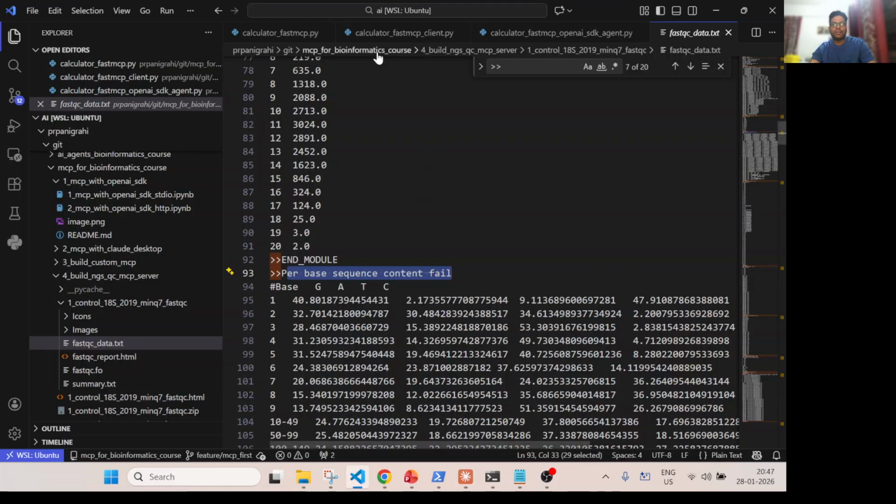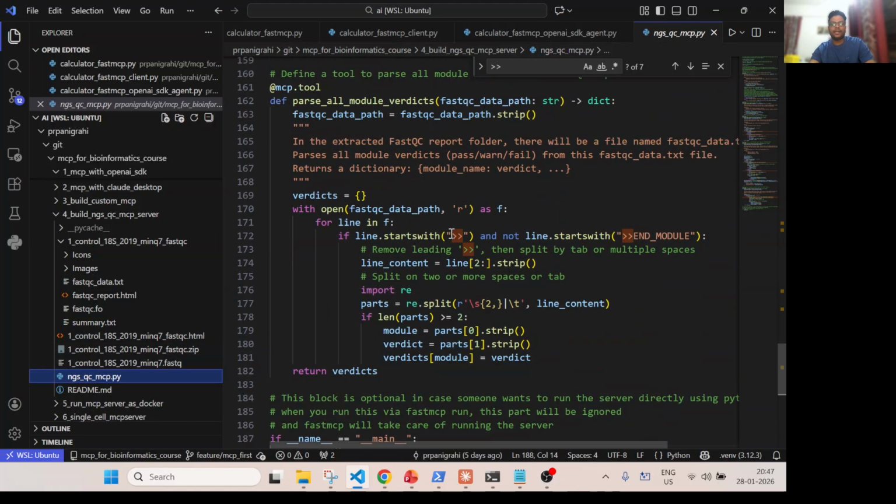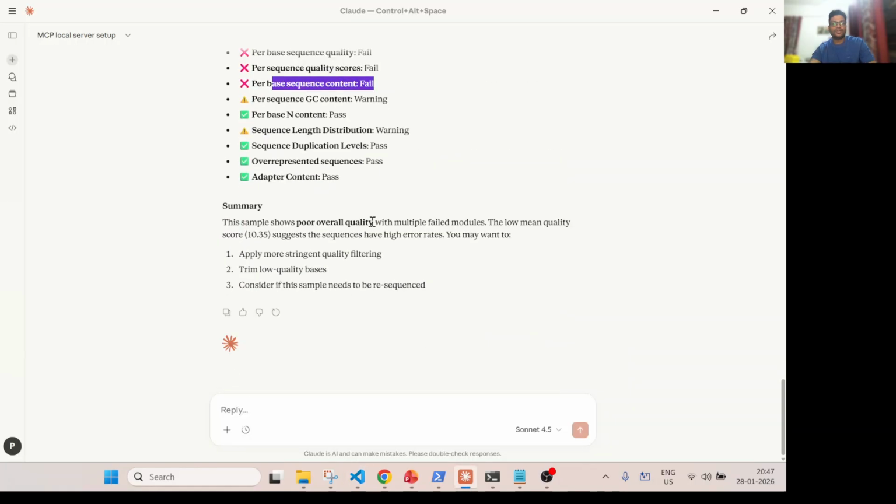So like that I wrote a Python function. What it did is it parsed only the grep one. So I see anything that starts with double arrow, greater than. So in short, you can see the beauty of MCP server. So what we did, we converted our very Python function and packaged it into an MCP server and hosted it. And now we connected this Claude Desktop to this MCP server.